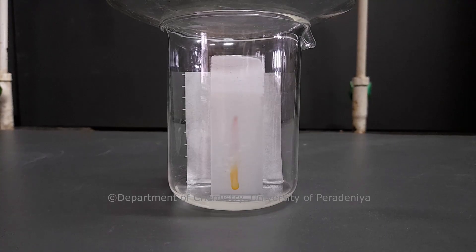Do not let the solvent get to the upper edge of the plate. If not, evaporation can take place which can cause errors.